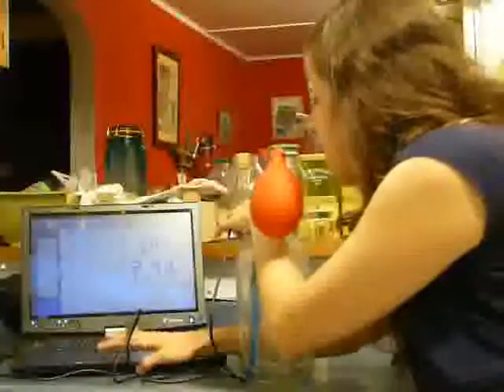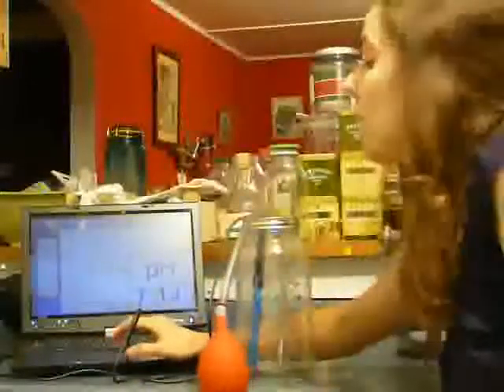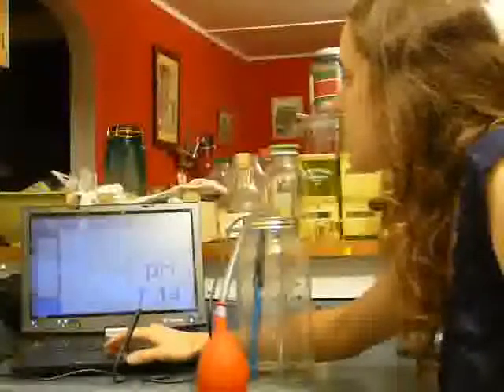All right. So there we go. We only got down to about 7.12. So as you can see, we're not getting the same level of drop as we did before. If we scale our graph, let's see if we move this guy out of the way, we can see, while we did run the experiment for much longer, we're not getting nearly the same amount of drop.